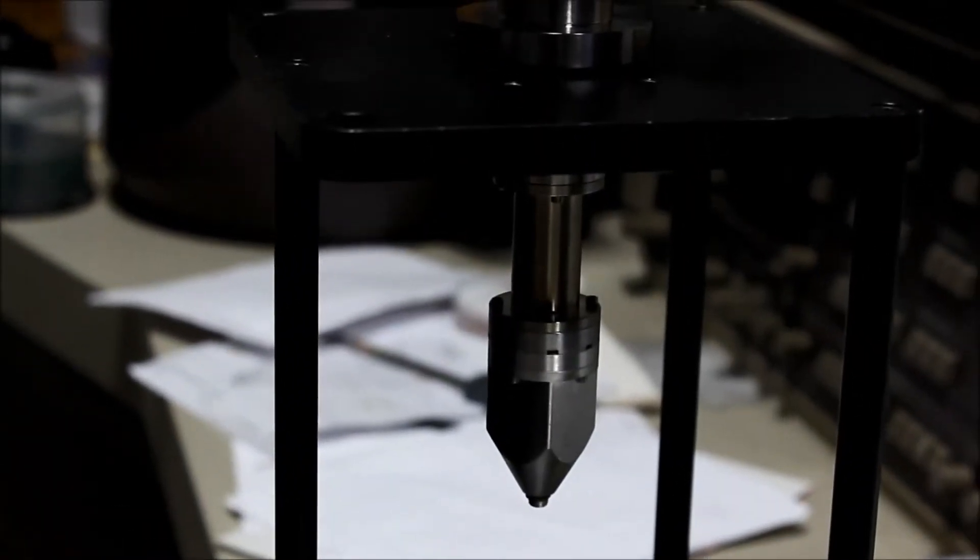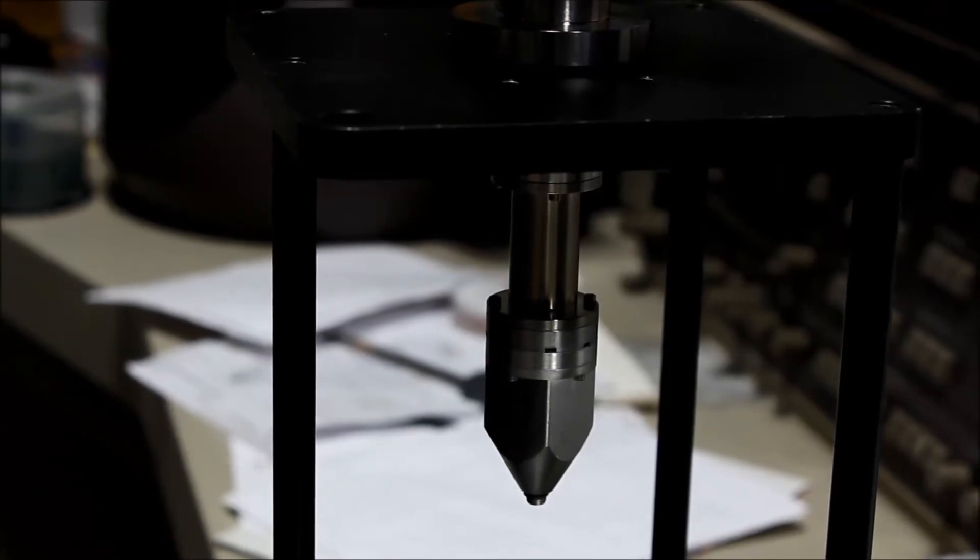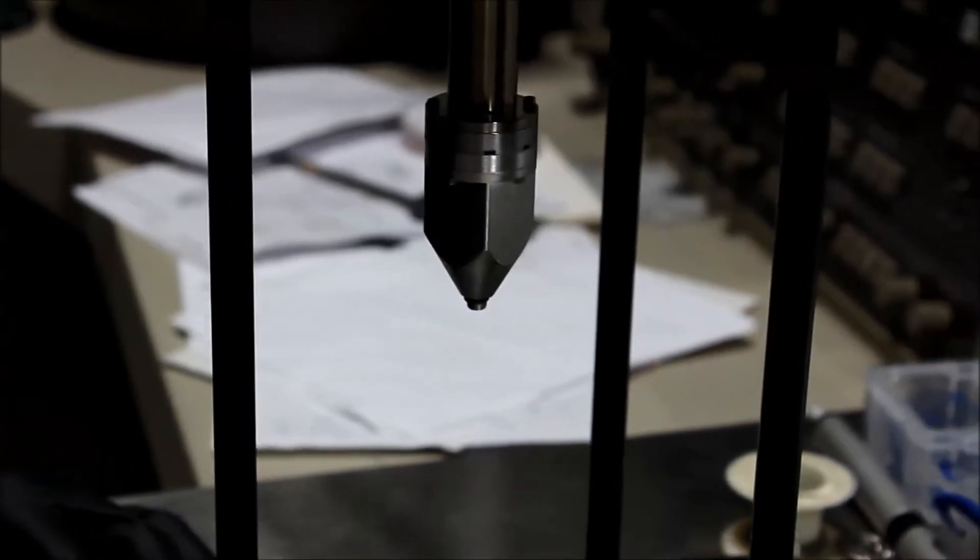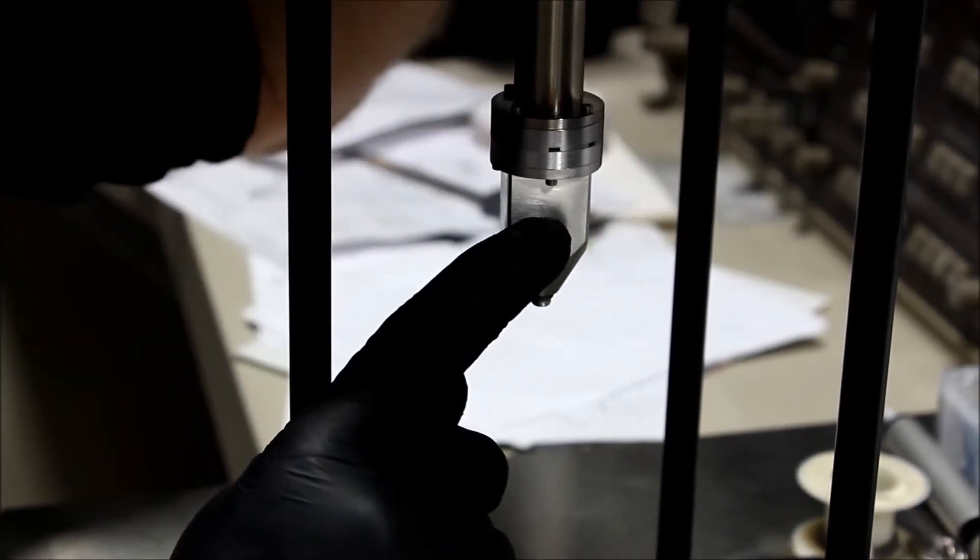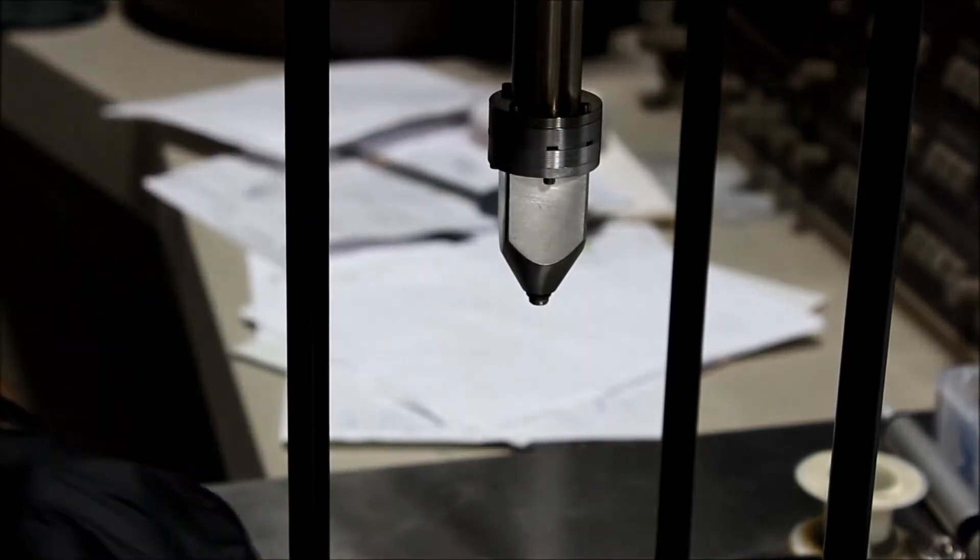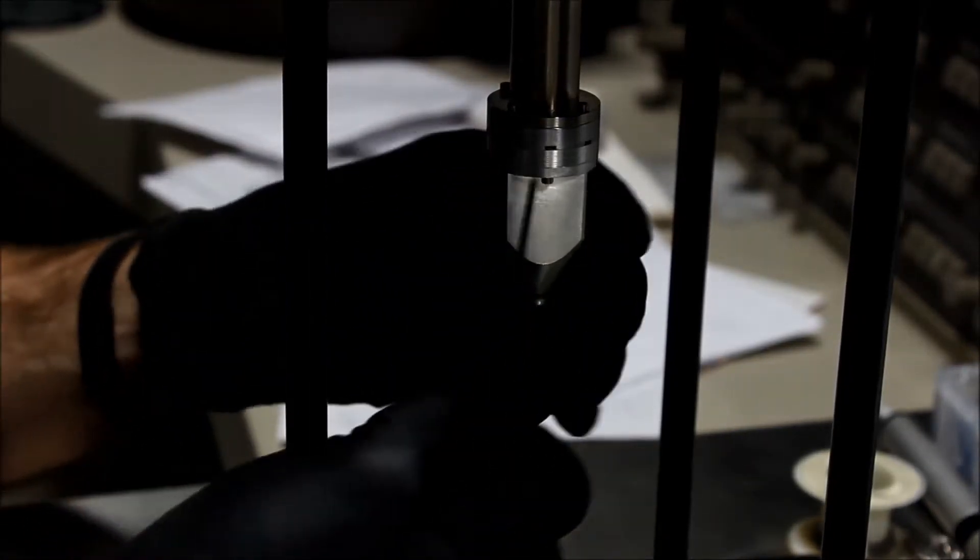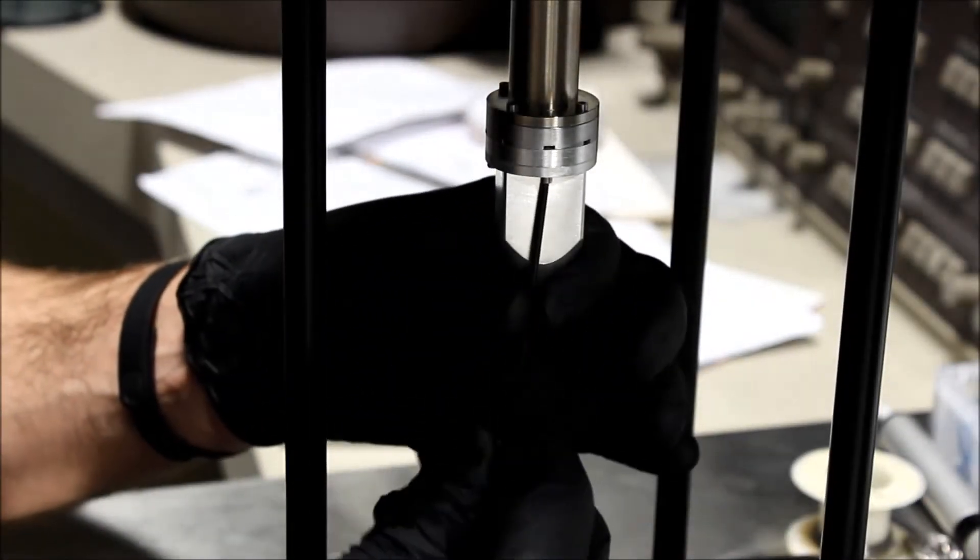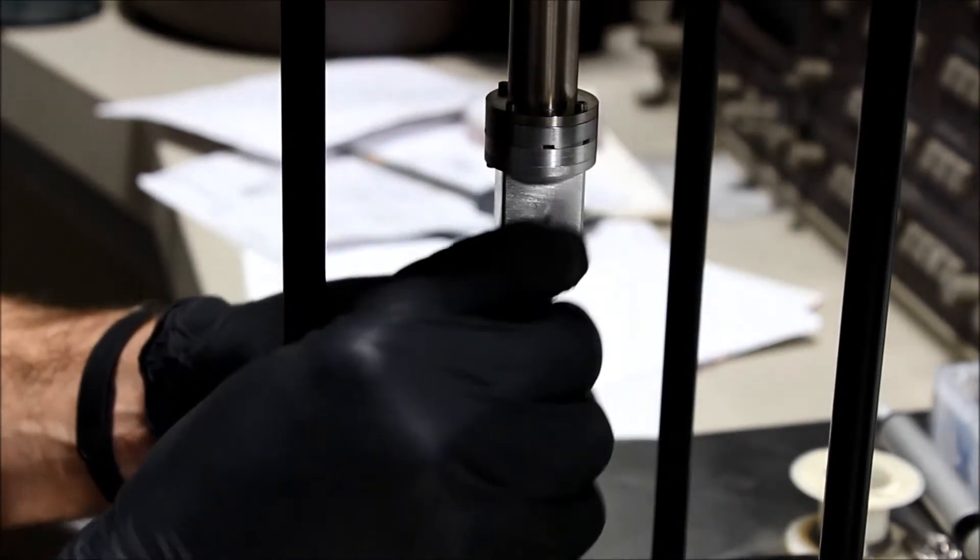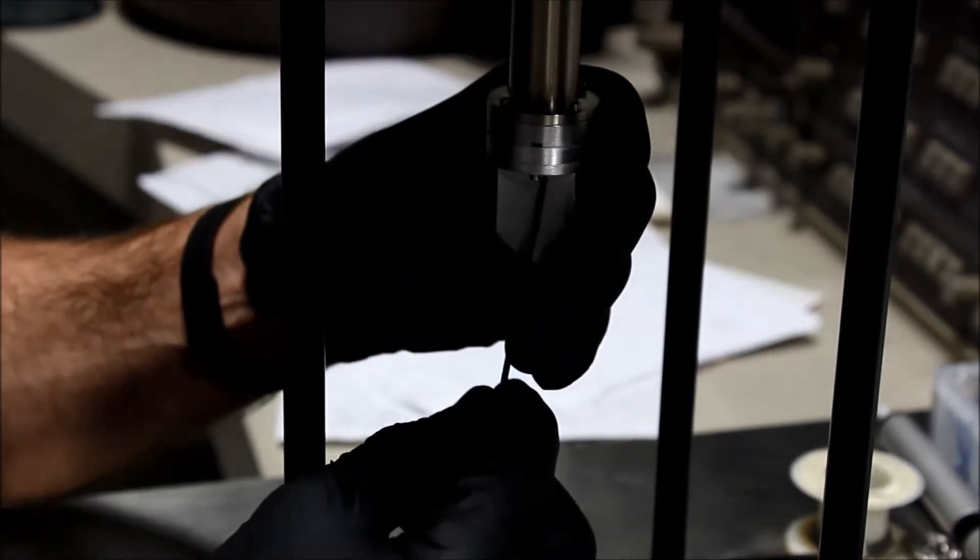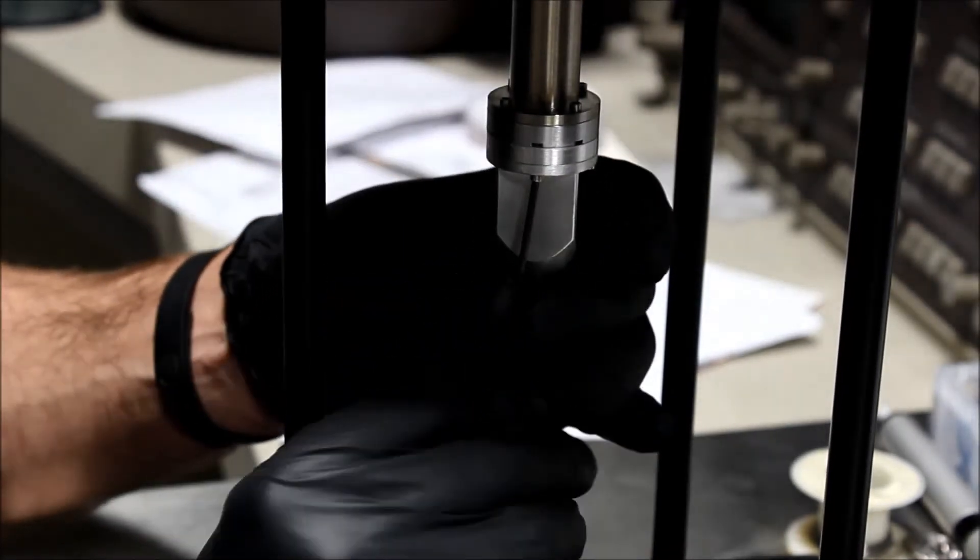You can see how it's held in the stand. We're going to remove the four little screws. You can see there are four little screws, and I use my 3/64 or 5/64ths ball driver to remove these screws. Be careful not to let these fall on the floor; they're hard to find. So we remove the four screws.